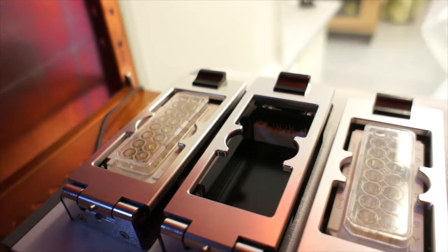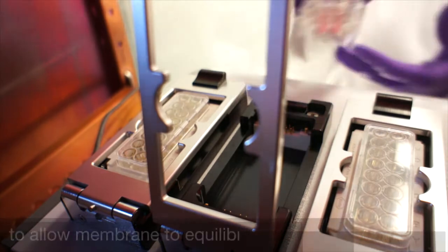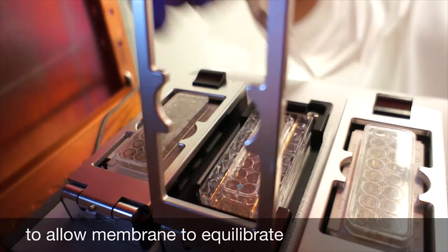Before adding cells to the upper chamber, a quick background measurement is performed with the CIM-Plate filled with culture medium.